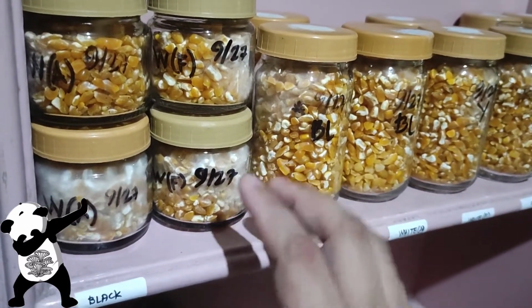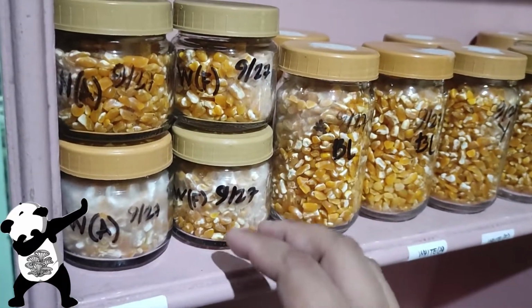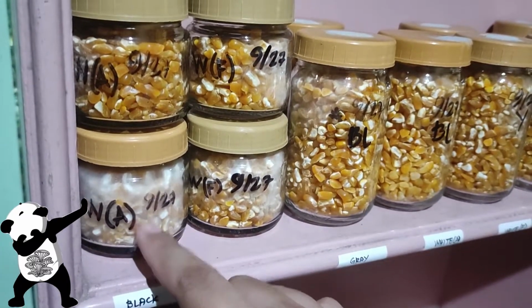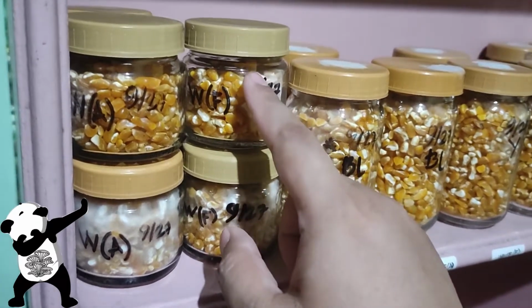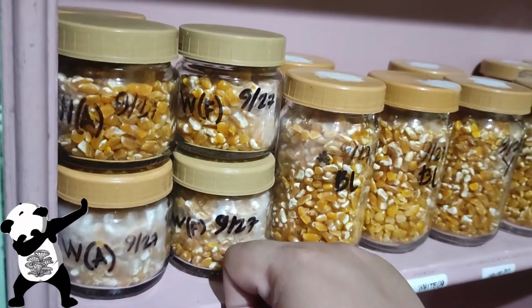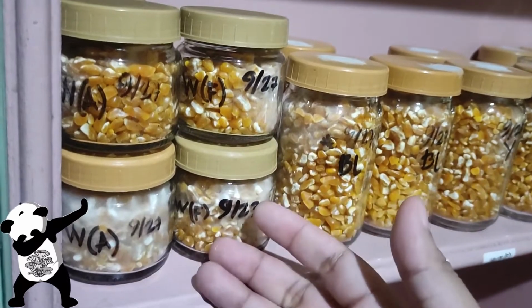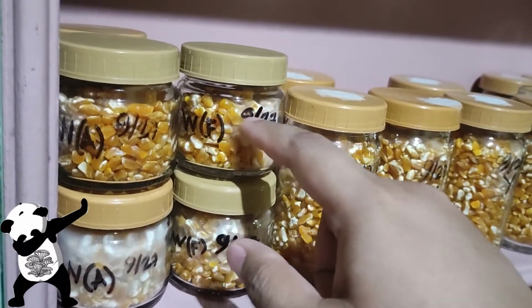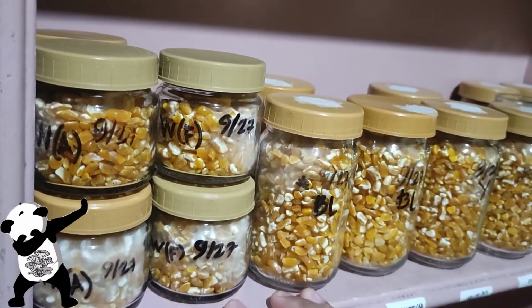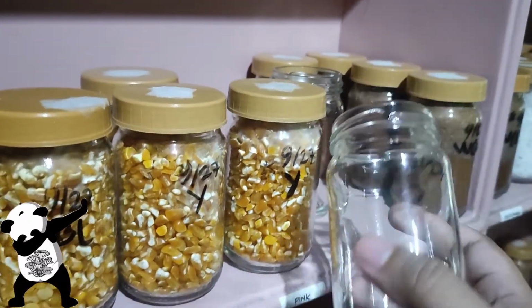Based on observation, since it doesn't have any holes, the moisture inside is actually being kept. That's why the mycelium likes it. And even though it doesn't have any holes, the sides might still give enough exchange of oxygen, but in the future I might have to lower the amount of grains so that there is more air inside, even after sterilization or after inoculation. And as you can see here, we have 2 empty bottles.